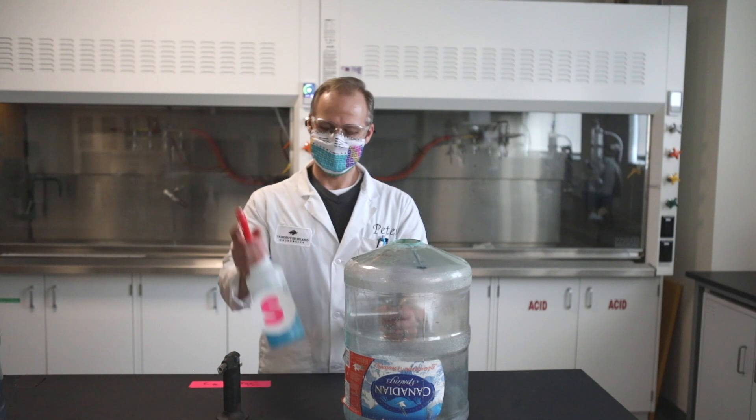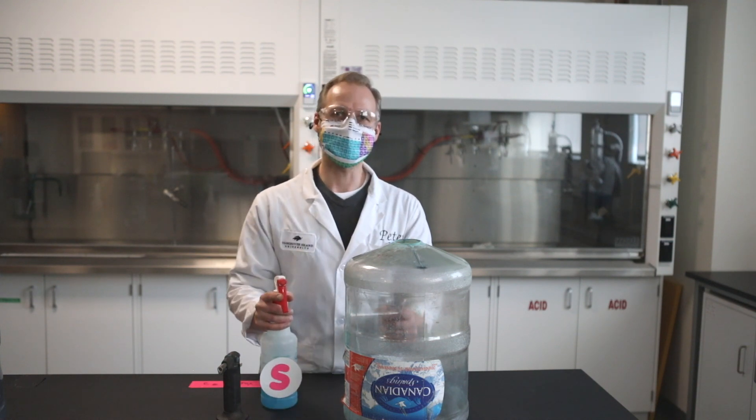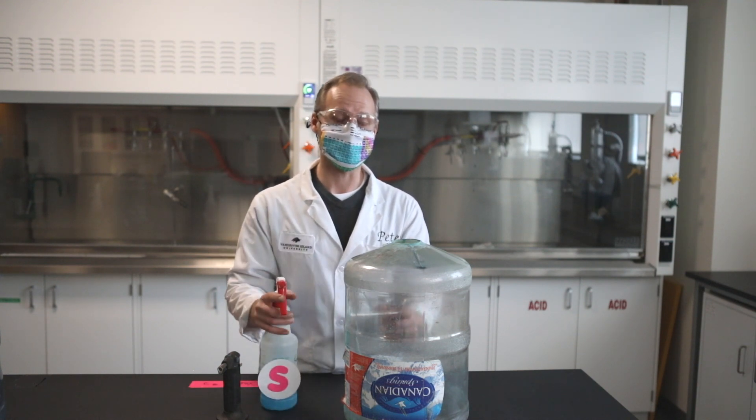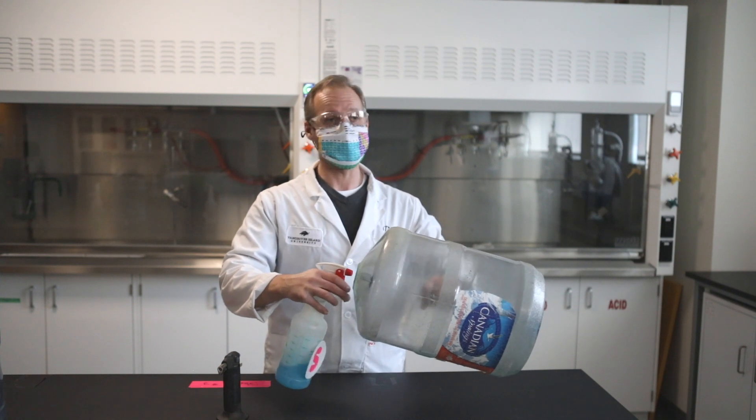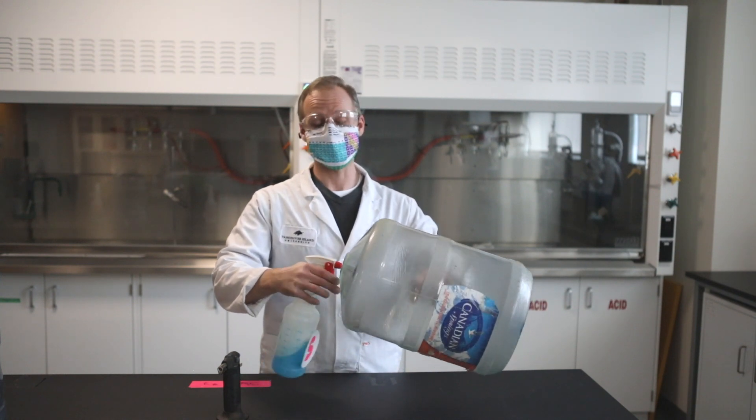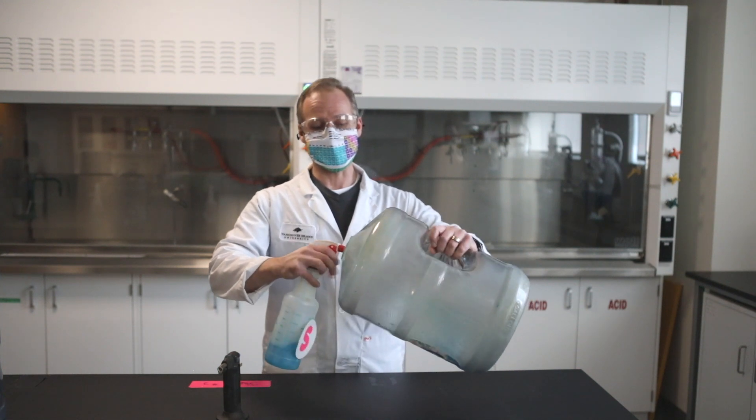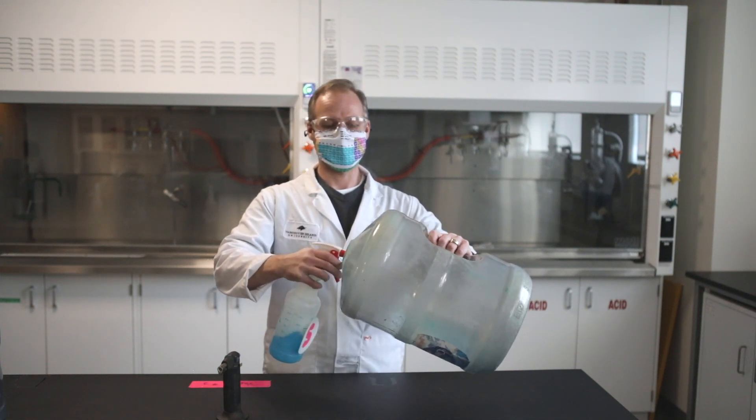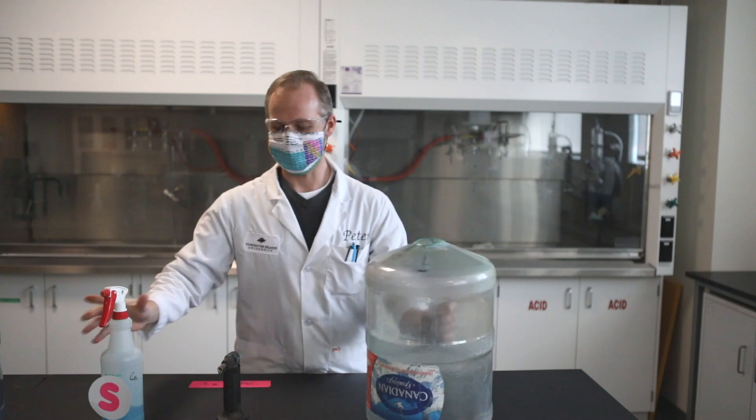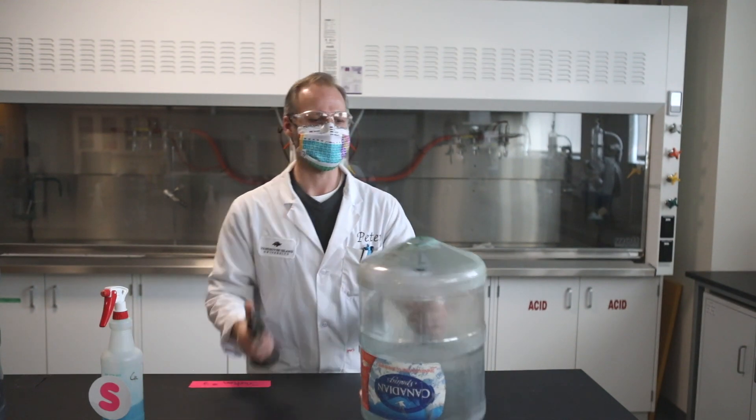So for the last one, this blue color, we'll see what it gives. It's actually copper, but we'll see what color it gives. Now to be honest with you, I gotta admit, this is one of my favorites. It gives the most intense color, the most exciting colors, and it's always fun to watch. So let's see what happens. Copper.